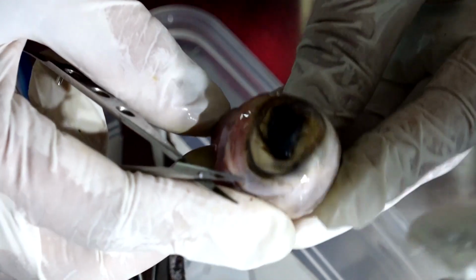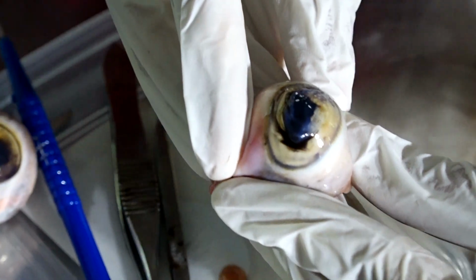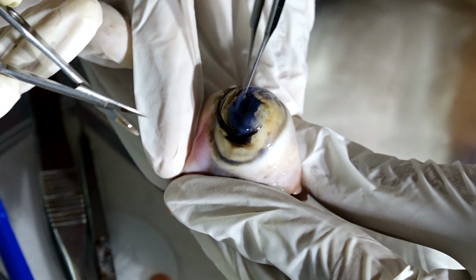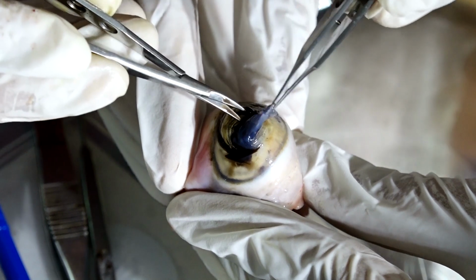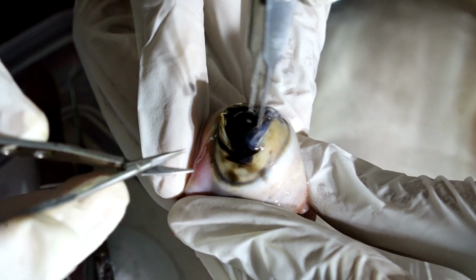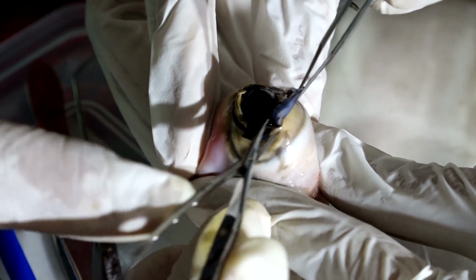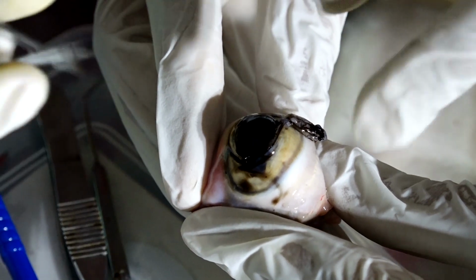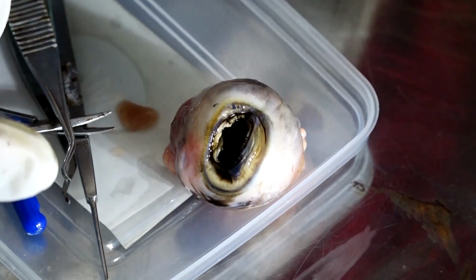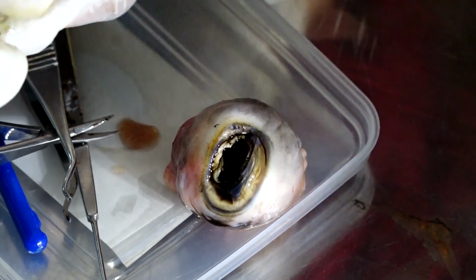Can you hold this for me? So I'm just going to lift. Can you see what I'm lifting now? The structure I'm lifting? Yes? Yes or no? Yes, this is called the cornea. Yeah, don't press. The lens will come out. Lens, okay. Now, keep it. Now, can you see the structure? It's folded.